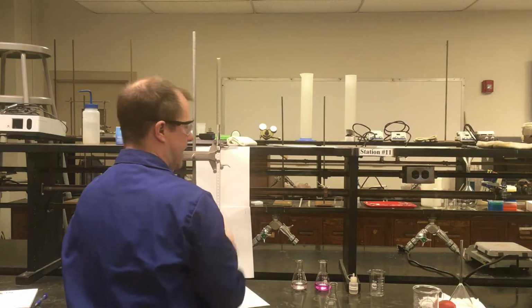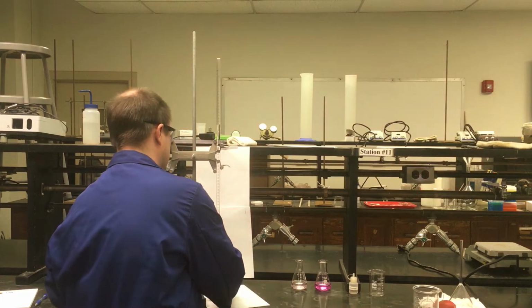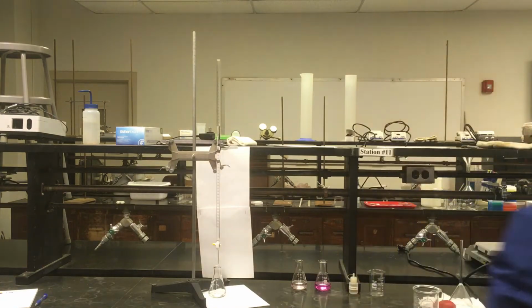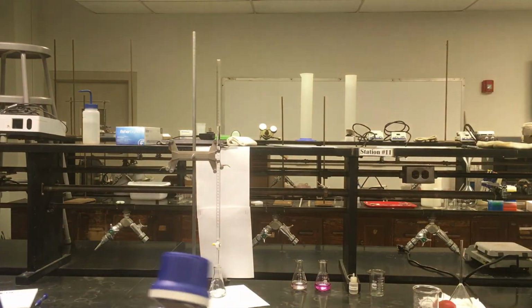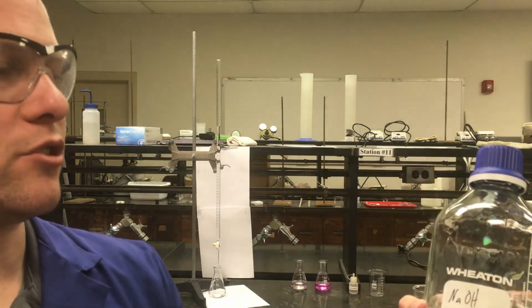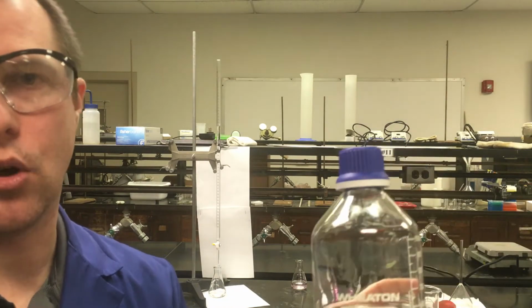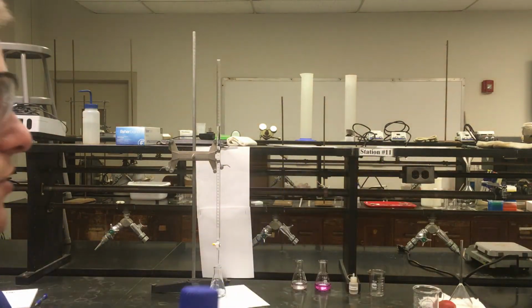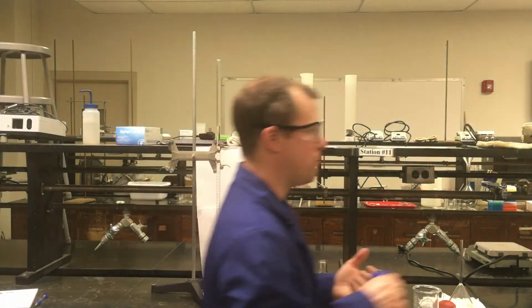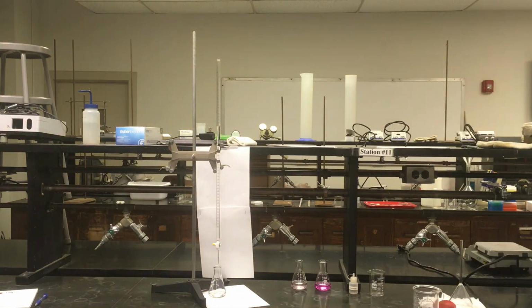Alright, so now that I have my sodium hydroxide, I'm going to go ahead and set things up. And I'm going to do one last thing here where I can check the concentration of our sodium hydroxide solution. Apologize for moving around a little bit here. So here's our sodium hydroxide solution. It's about concentration 0.167 molar. So that's going to be our concentration that I said that we have to know of the titrant. And then we'll measure the volume that we're going to have to add over the course of this reaction.